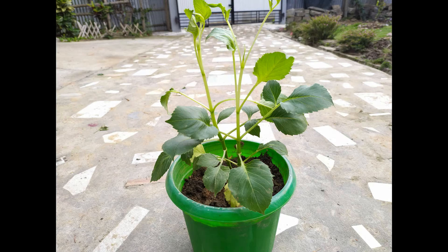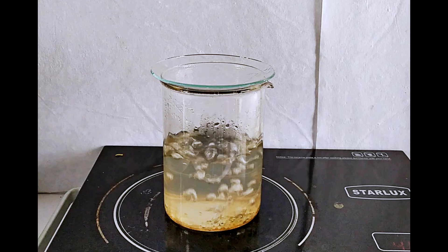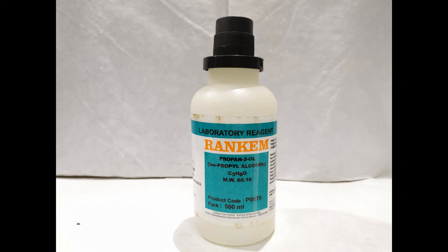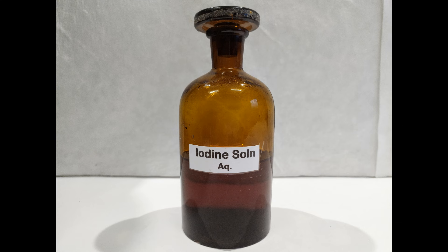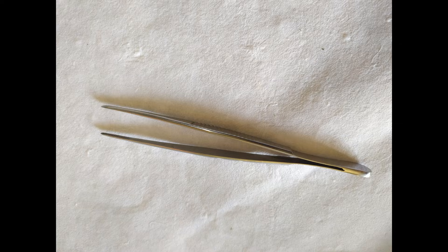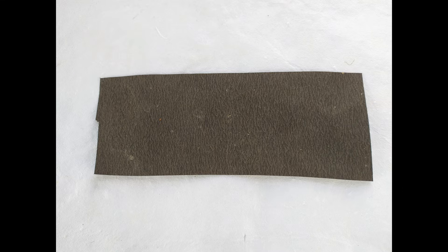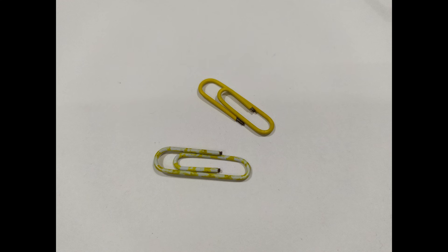A potted plant, preferably with wide leaves. A water bath. A large test tube. Ethanol, isopropanol, or methylated spirit. Aqueous iodine solution. A petri dish. Forceps. A piece of black paper. A pair of scissors and sticky tape. Paper clips.